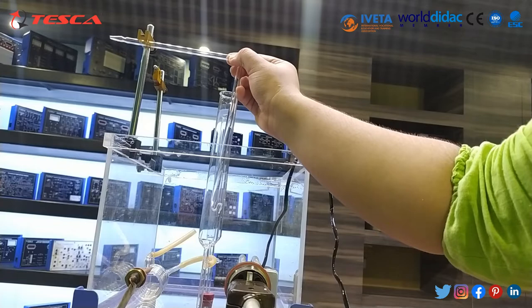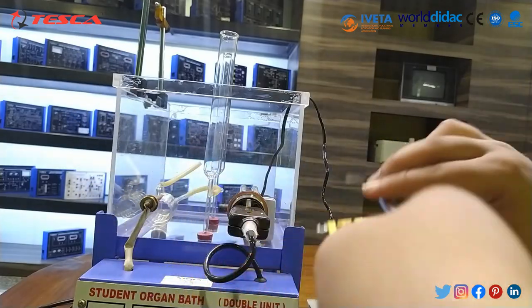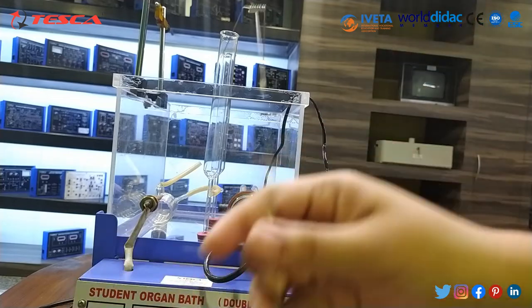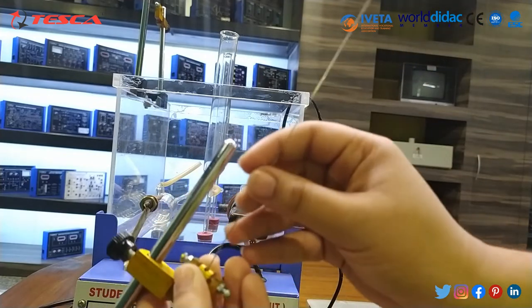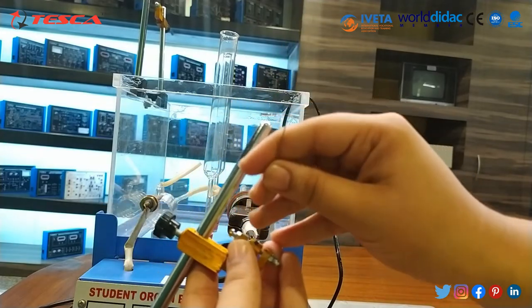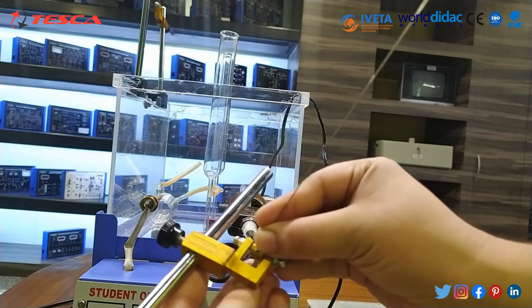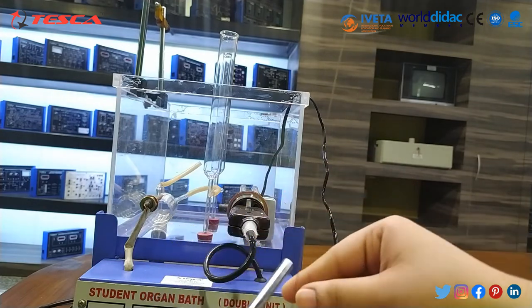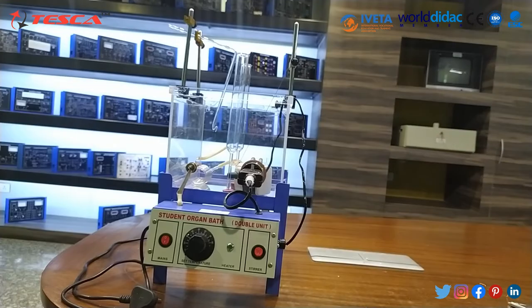In the brass head, fix the lever — there is a small hole, so insert it in and tighten it with the screw. This is the whole setup arrangement.